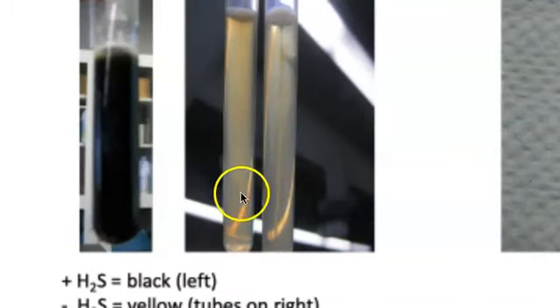if you look at these two tubes that are still yellow, the one on the right is negative for motility, and you can see this central line that's fairly distinct. That means that all the bacteria that were stabbed into the culture have stayed put. They have not started to swim away. So this tube on the right would be negative for motility, whereas this tube on the left, you can see cloudiness and fuzziness emanating from where you stabbed it. And that means the bacteria started here in the center, but then they've started to swim away.